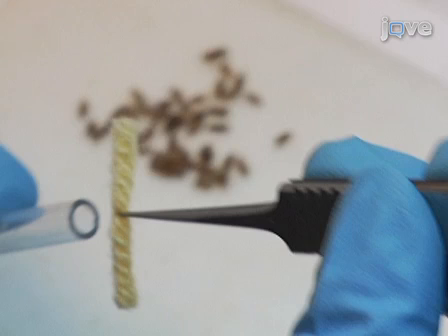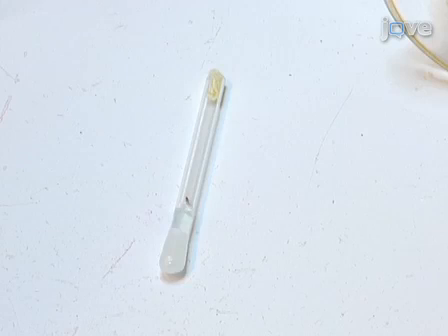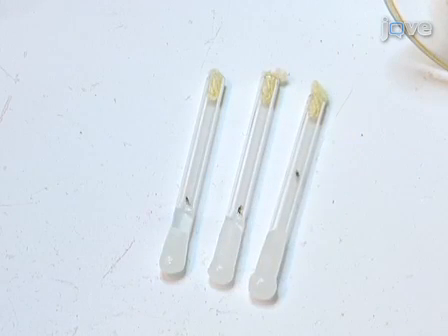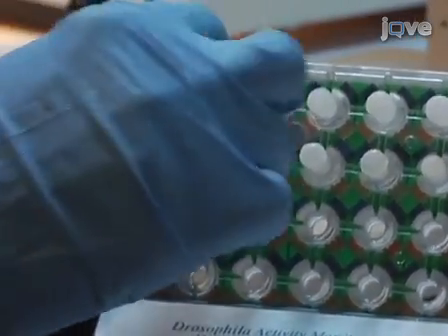Grab the middle of a single piece of yarn that is around ½ an inch with fine forceps and insert the yarn into the non-food end of the activity tube to plug the opening and prevent the fly from escaping during the experiment, while at the same time allowing airflow into the tube. Keep the tube laid on its side until the fly awakens, to prevent the fly from getting stuck to the food. Insert the tubes into the activity monitors.